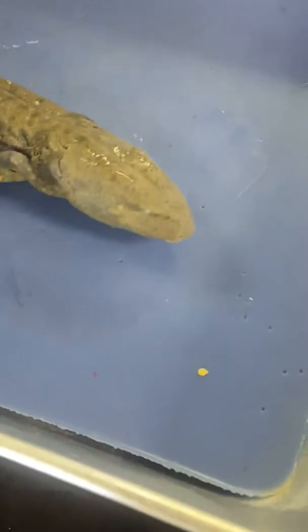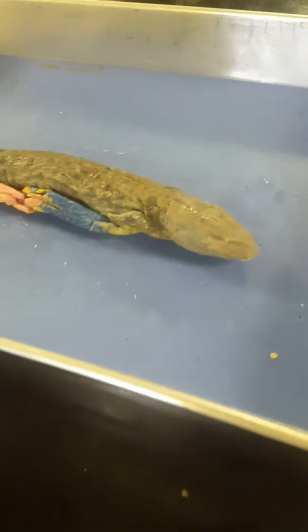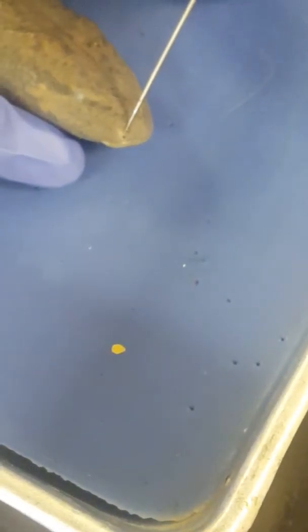The lateral line should be just a little line on its head. They're really hard to see on this one, but if you look right behind the eye there's a little line that curves up through here, and that's one of them. And then external naris — it's this little dot right below the pointer.